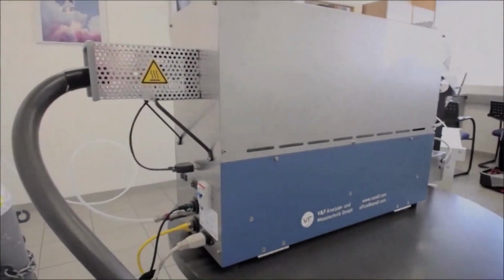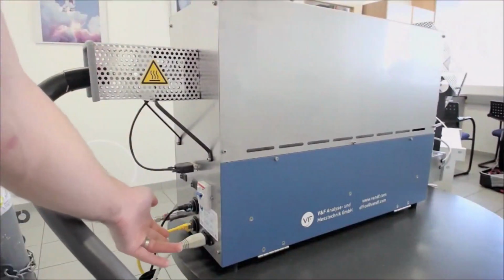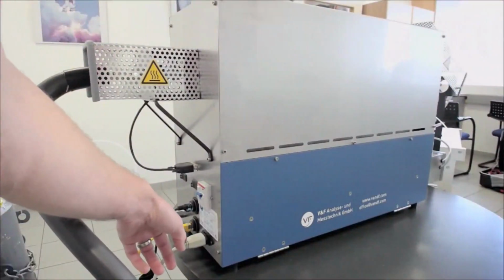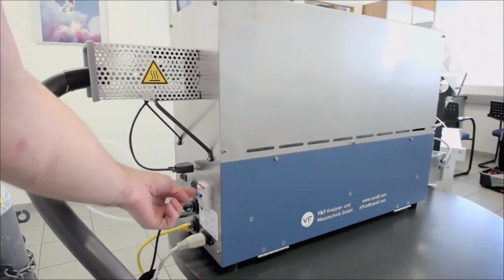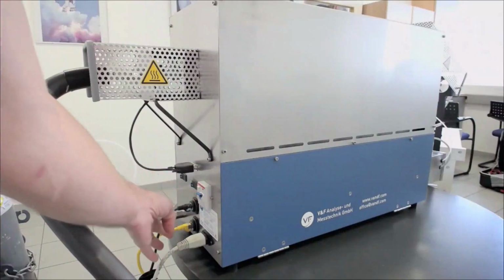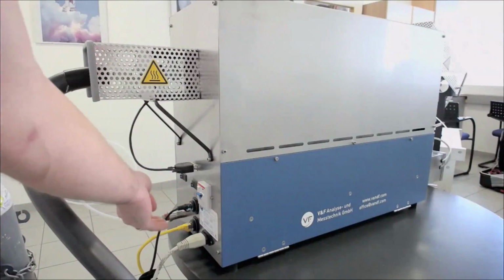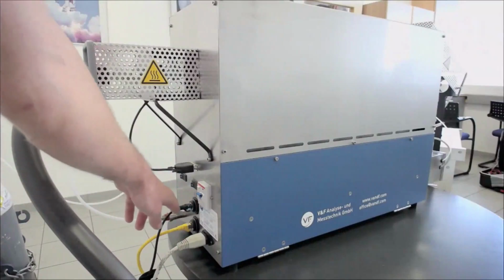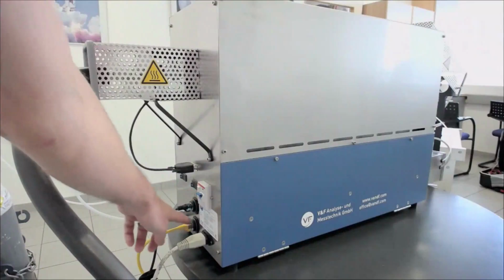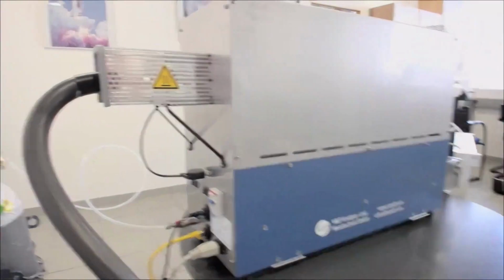The next part will be connections on the gas oxidizer. So again, we have a power supply, which is this white cable here in this case. We have a main circuit breaker for the furnace. We have 2 Ethernet ports. So these are bridged on a switch so that you can connect your PC to one port and then go from the other port to the instrument. And so both of the systems will always be physically in the same network.